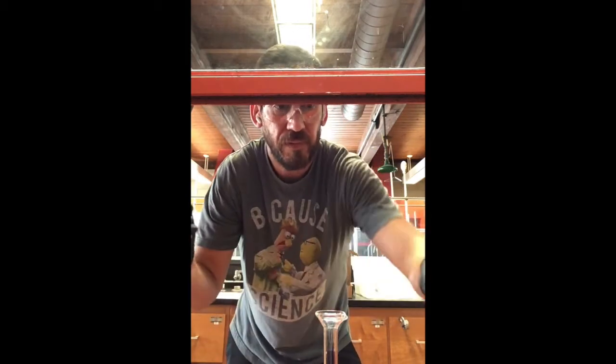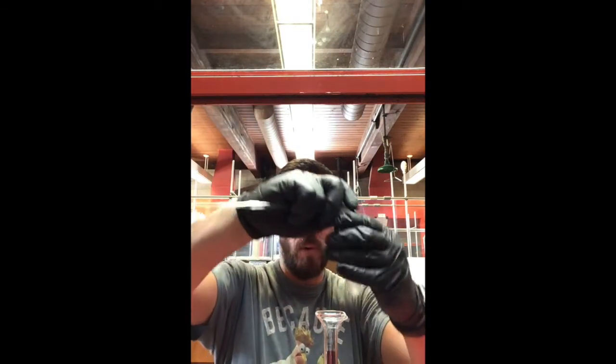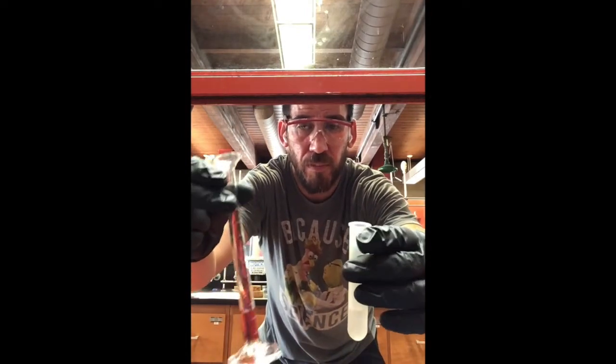Now, if you were exact, then you could just pour that right into the centrifuge tube, but that's not quite exact.